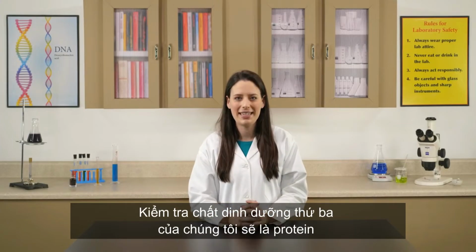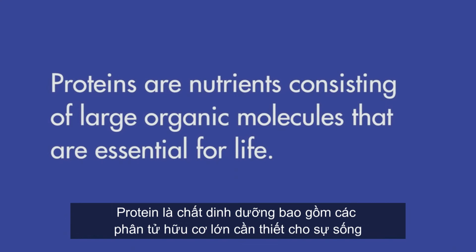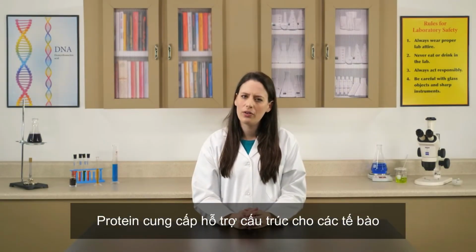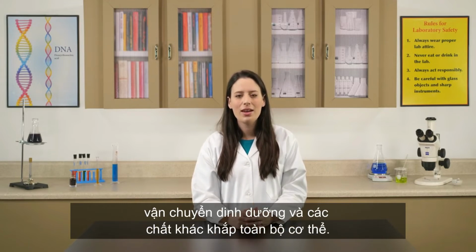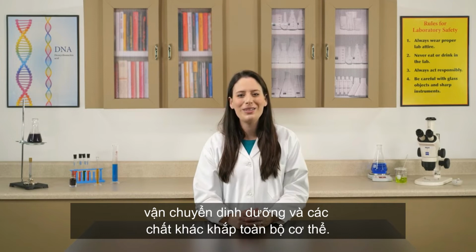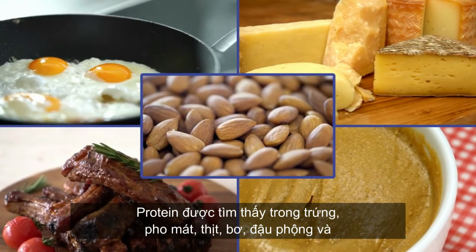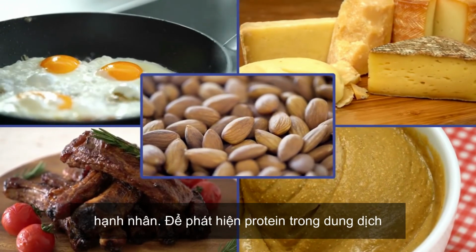Our third nutrient test will be for proteins. Proteins are nutrients consisting of large organic molecules that are essential for life. Proteins provide structural support for cells, regulate metabolic processes, and transport nutrients and other substances throughout the body. Proteins are found in eggs, cheese, meat, peanut butter, and almonds.